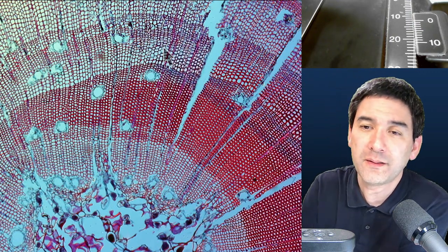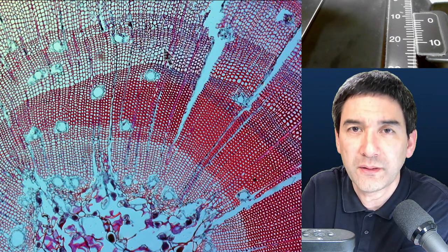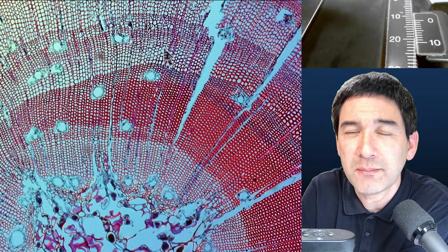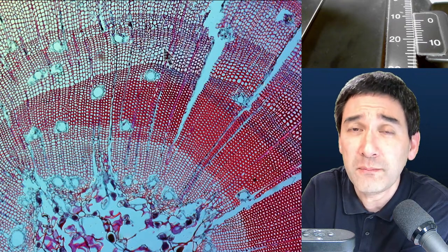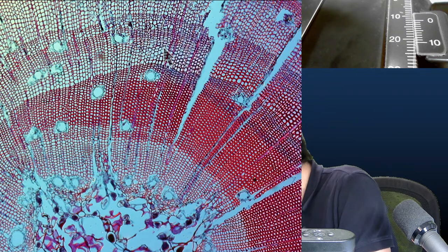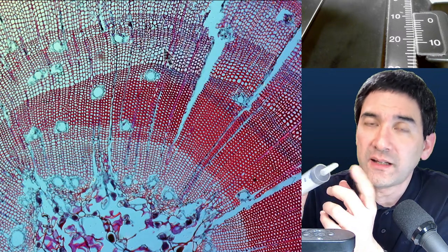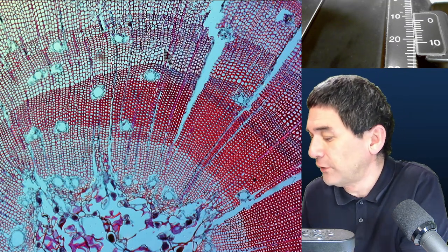Someone made their own mounting media and wants to filter it because they see some dirt. The question is: is it really dirt or just non-dissolved substance? If you want to filter it, you may need a little bit of pressure since mounting media can be viscous. You might use a very fine metal mesh, or try pressing it through a syringe — maybe with some cotton in it — provided the solvent in the mounting medium does not attack the plastic.